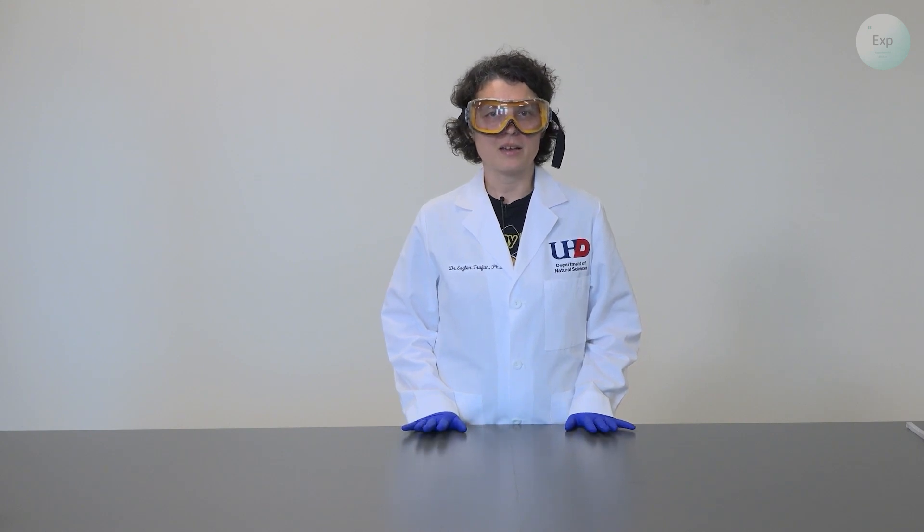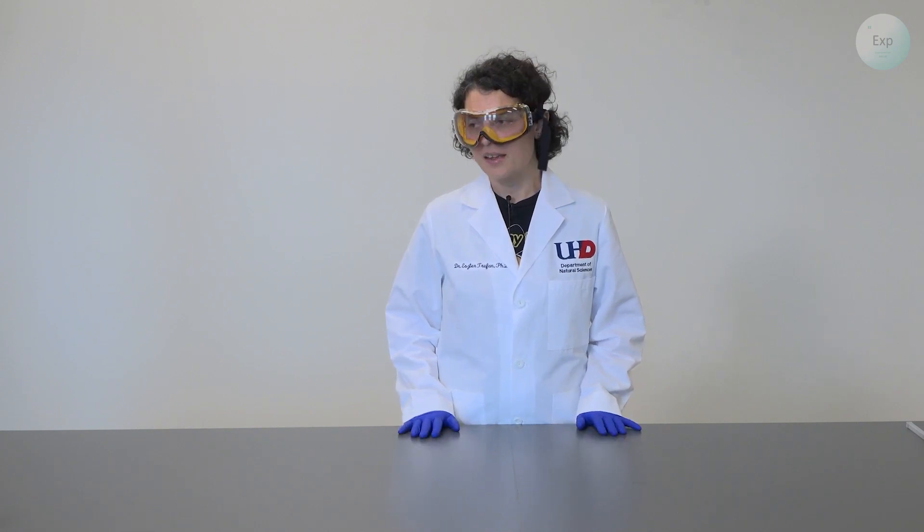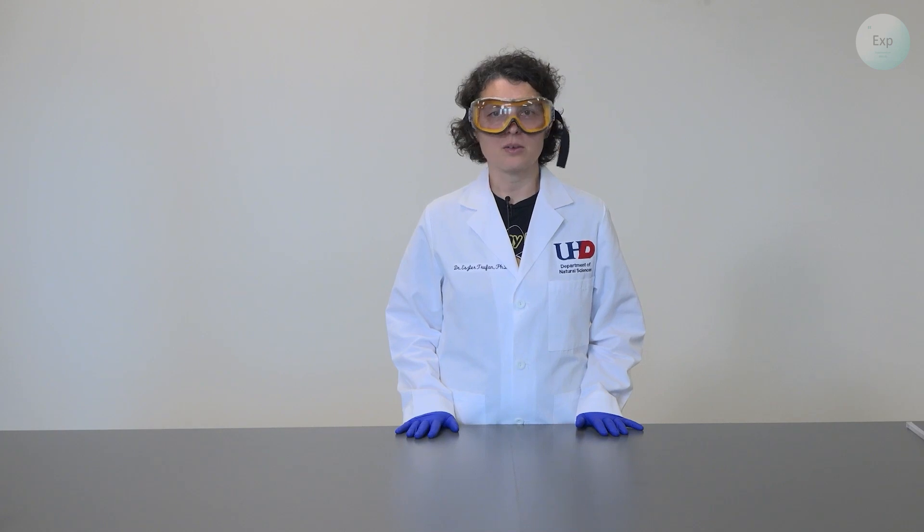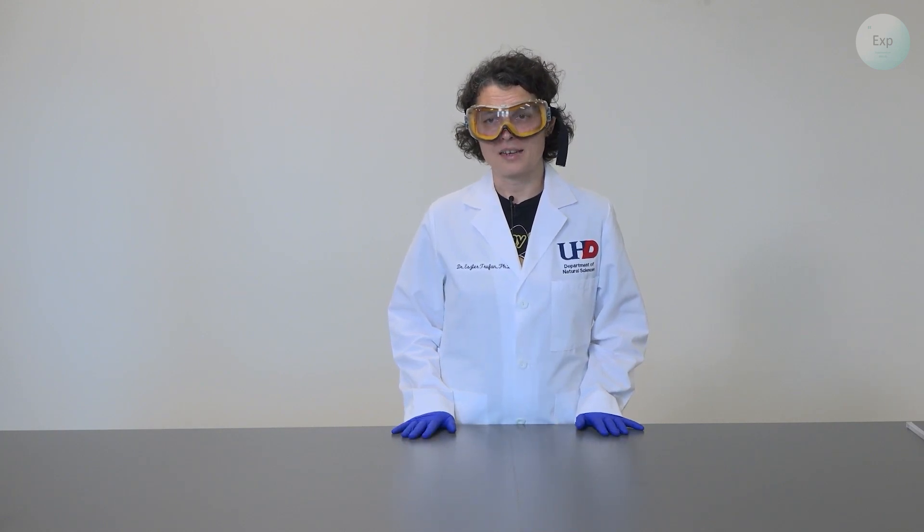In a previous video I demonstrated how calcium chloride may affect the melting point of ice or the freezing point of water and I prepared two solutions and I also prepared a slurry in which I just mixed water and ice.